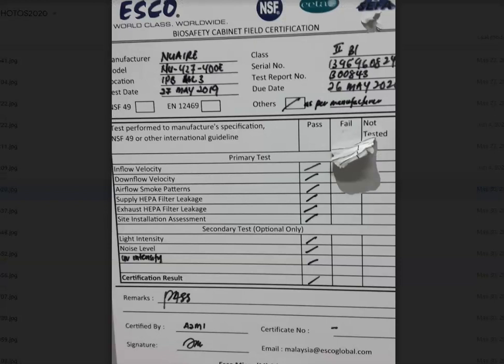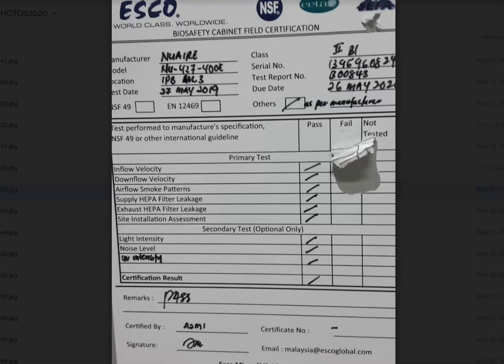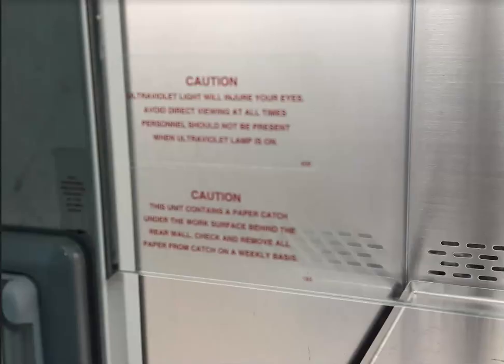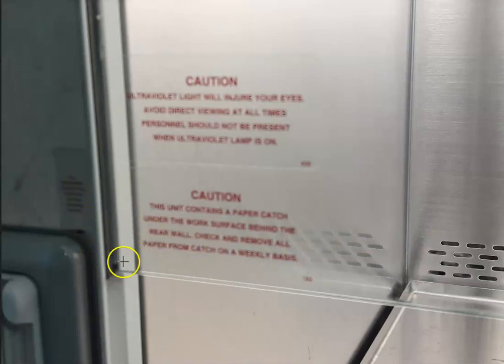This is a certification label; prior to using this biological safety cabinet one needs to ensure that the certificate is valid. Biological safety cabinets must be validated periodically based on the standard operating procedure in order to ensure safe working operation, and should not be operated beyond their safety limits.